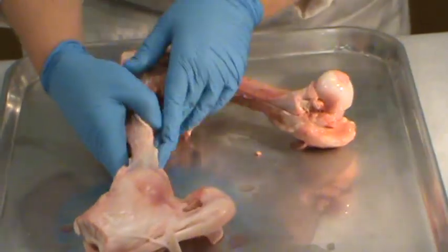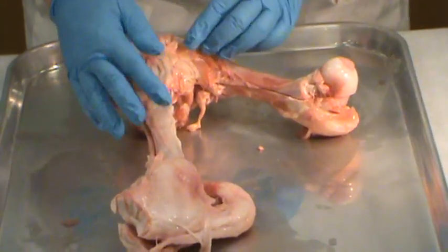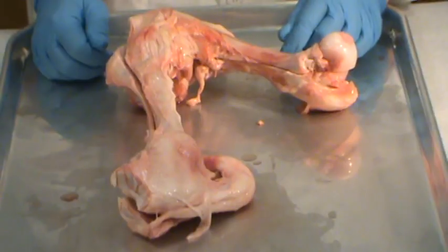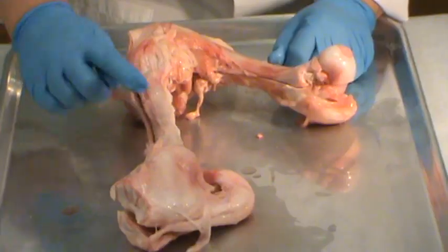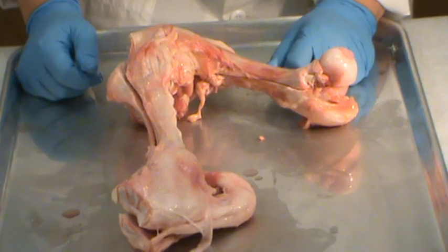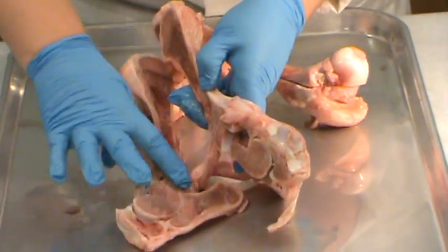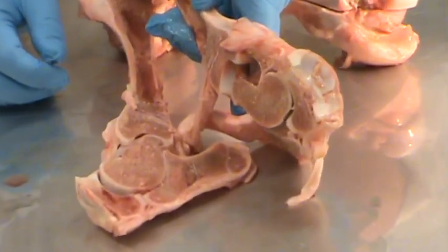The tibia, which is the bone in the lower leg in this animal, is larger than the femur — and that is different than in humans, where the femur is larger than the tibia. The other difference is that these animals have hooves, which gives them a different bone structure in their foot than humans, so you'll see some differences in the foot joint as well.